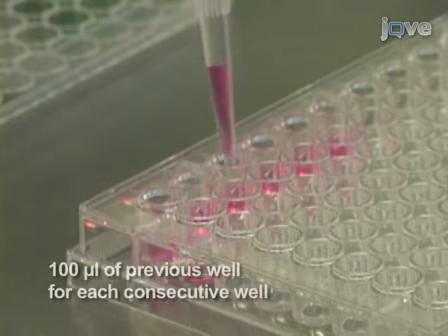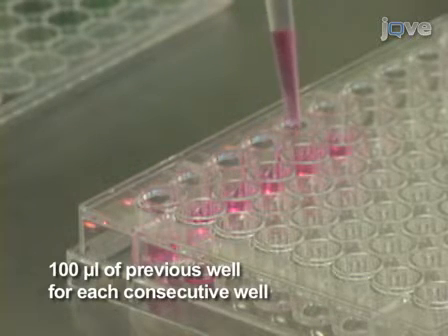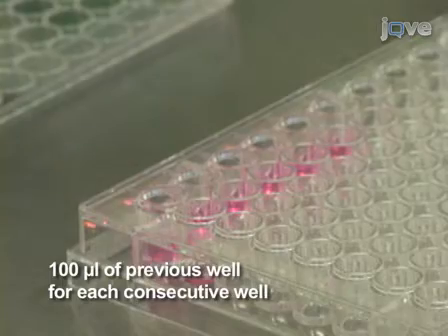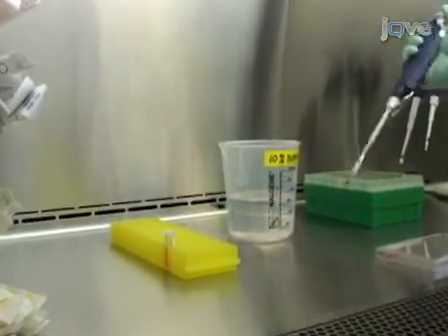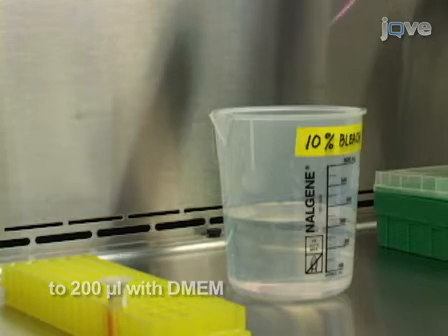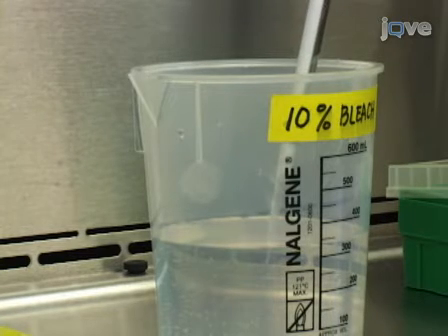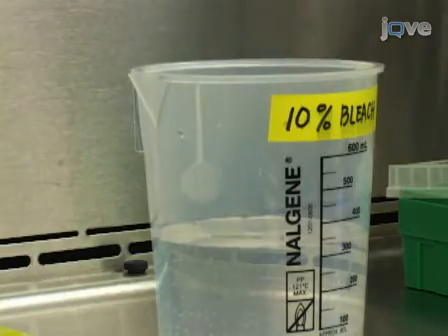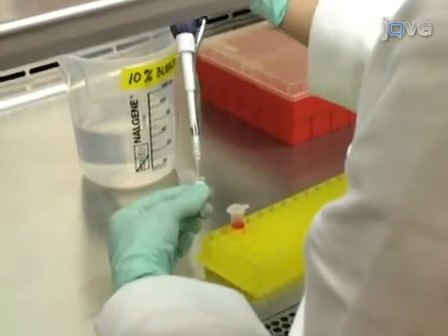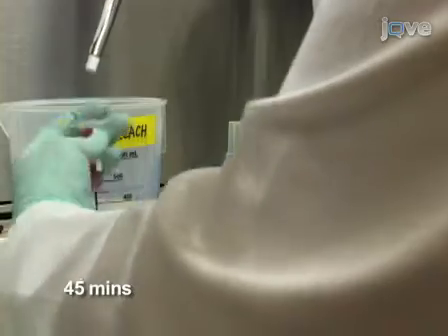To the 3rd well, add 100 microliters of the mix from the 2nd well. To the 4th well, add 100 microliters from the 3rd well. To the 5th well, add 100 microliters from the 4th well, and to the 6th well add 100 microliters from the 5th well. Finally, take 100 microliters out of the 6th well and discard in bleach. Bring the total volume in all wells to 200 microliters with DMEM. With each dilution the viral concentration decreases by half. These are suggested dilutions which should work well for titering most concentrated viruses. If your virus is low in titer or unconcentrated, you may need to adjust your dilutions. Treat any unused diluted virus with 10% bleach for 45 minutes before discarding into a biohazard waste container.